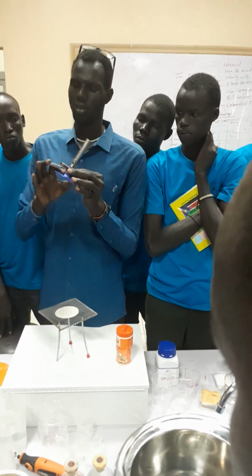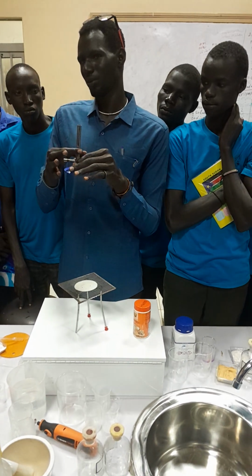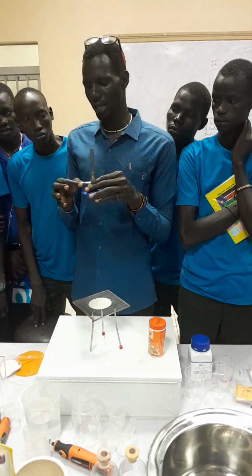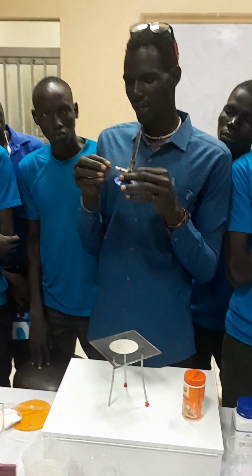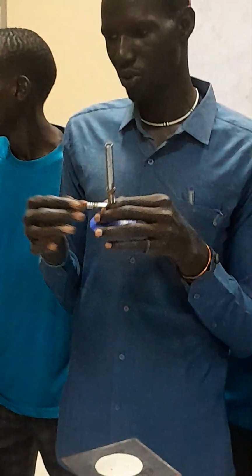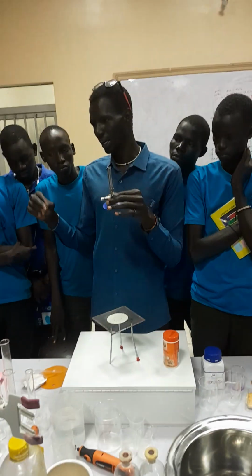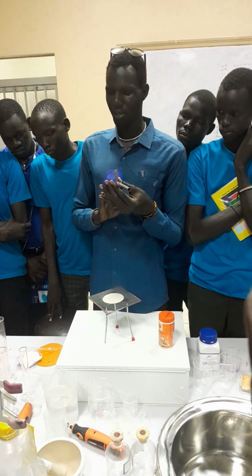And then the whole of this part is called the base. The base supports the burner so that it may not topple. The term topple means it may not fall down. And this one, which looks like a tube, we call the rubber tubing. It is the one you connect to the source of gas. You bring a tube made of rubber or any plastic and put it here. Then it is connected. So this is the Bunsen burner.